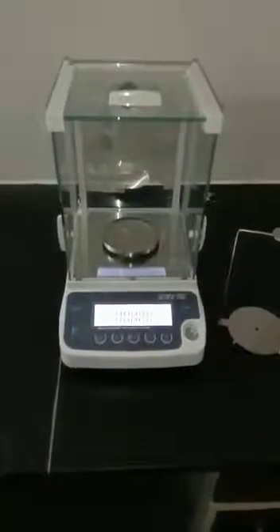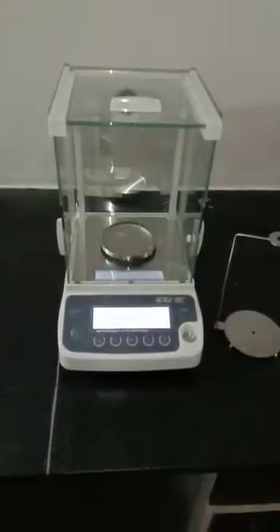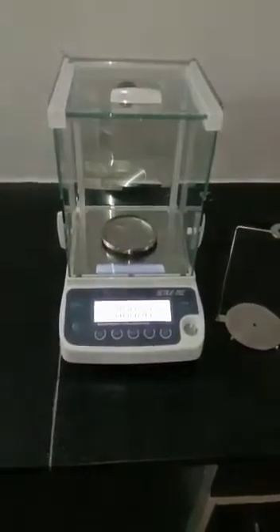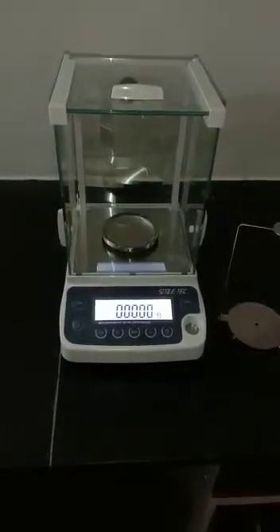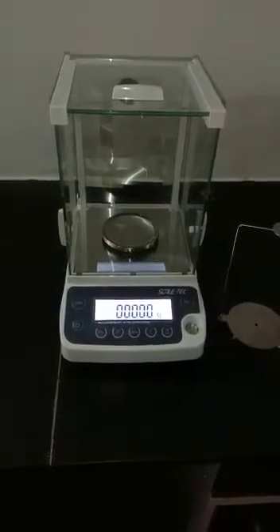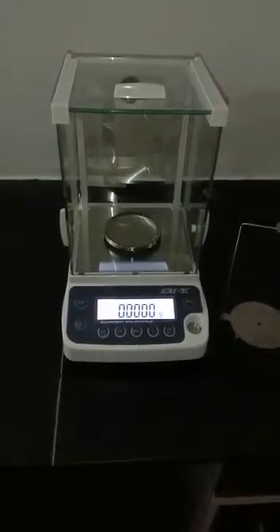Hello everyone. In this video we will show how to find the density of a particular material. We have a balance available here which is called 224CL, which has a capacity of 220 grams with an accuracy of 0.1 mg.